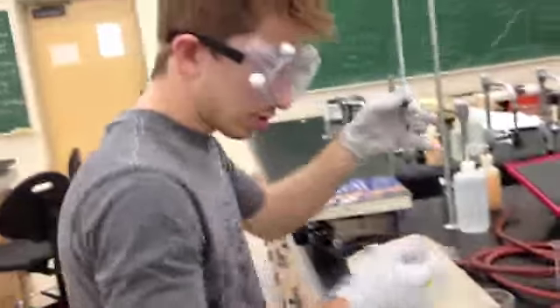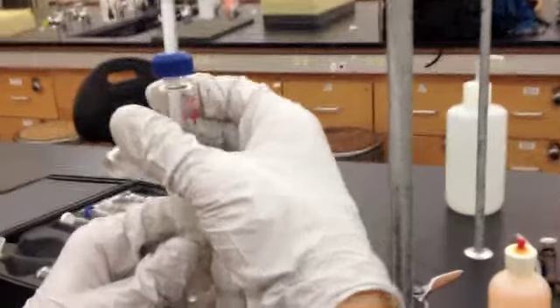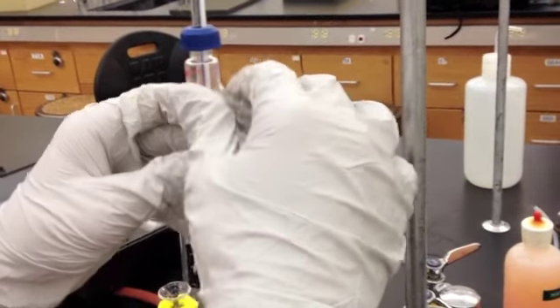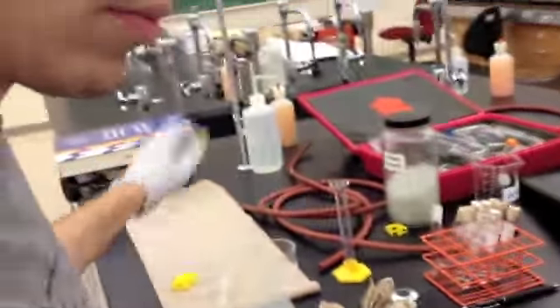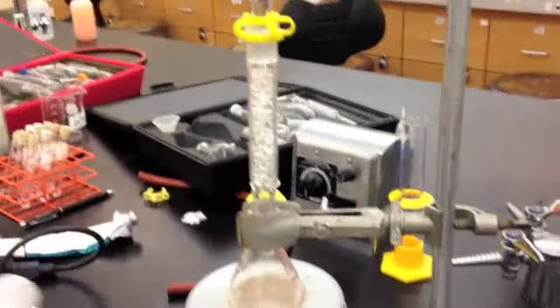Now, again, grease the joint a little bit. You have one portion which is where the water is going to go out. Ensure you have clamped over and seal it. Put a keck clamp in place. And this is for the water that's exiting the condenser. It has to be in the top portion. And you've secured the first part of your apparatus.